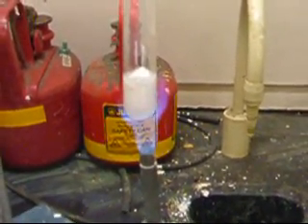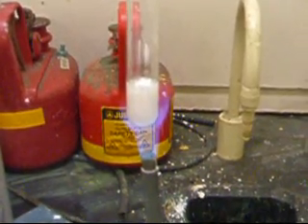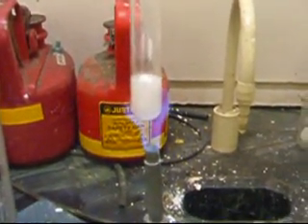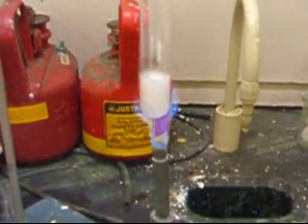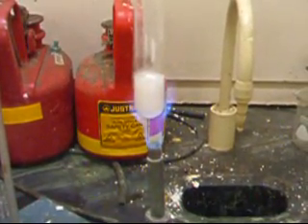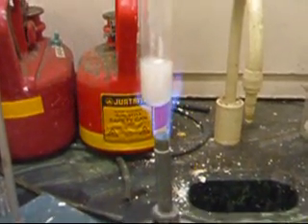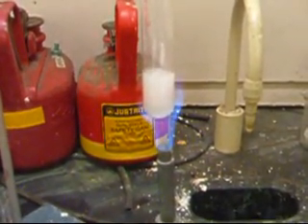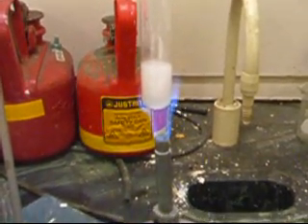Now that this is basically all melted, it's eventually going to start decomposing. And when it starts to decompose, I'll see a white smoke coming up and starting to form. We're going to test it for the presence of oxygen — does anyone remember from our types of reactions lab what to test for the presence of oxygen?